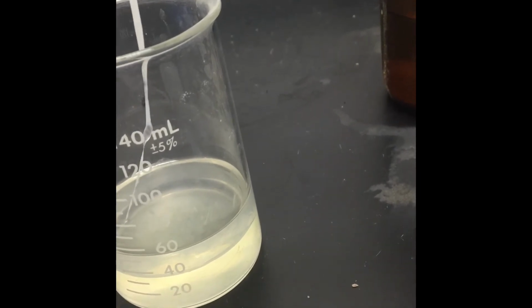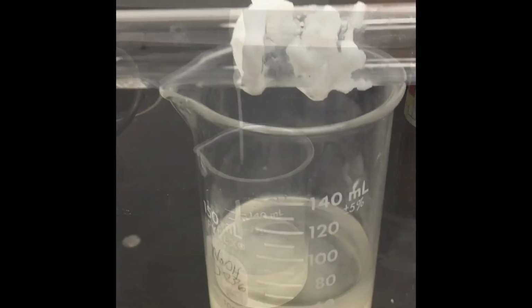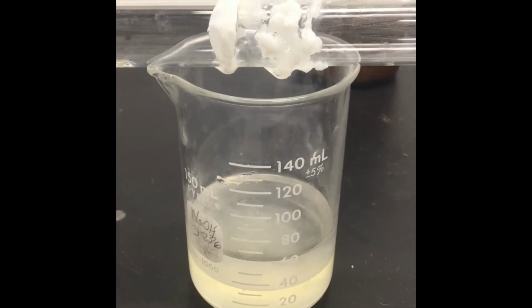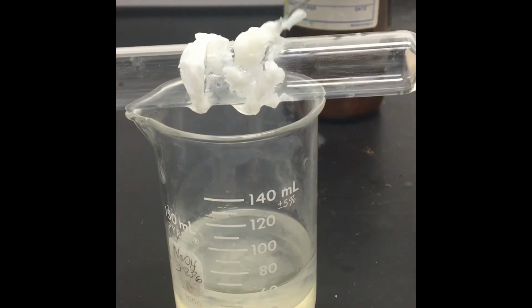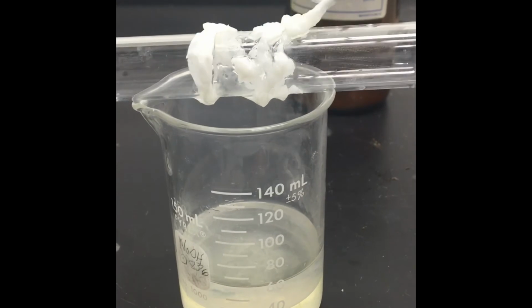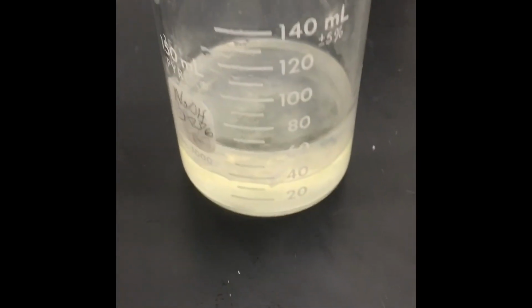Now I'm trying to not break it, but I don't know if I'm going to be very lucky. Usually, oh, see, it already broke, but that's okay. I am going to add it to a test tube. Well, as you can see, I've been pulling some of that nylon and just wrapping it around a test tube. And if we have a lot of it and we are extremely successful with it, we should just be able to get like a long strand. I'm just doing this as a demo, so you can see that we start with these two liquids, and they're forming a solid in the middle, in the boundary. You can see that I can still pull more.